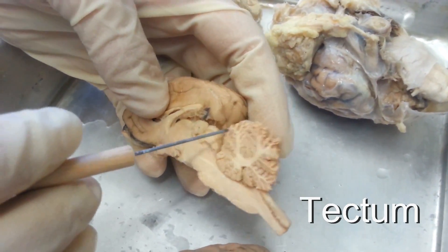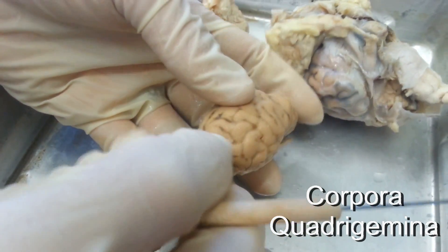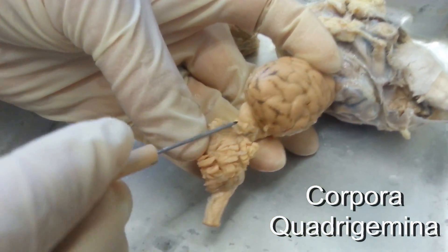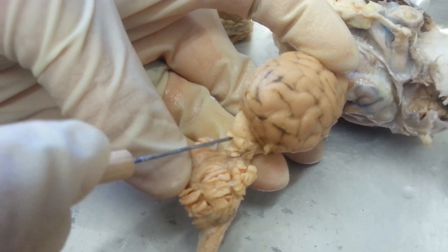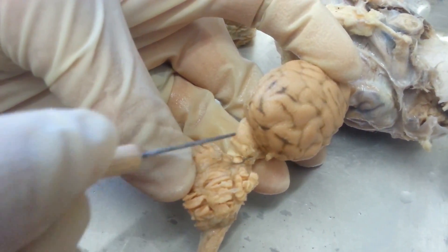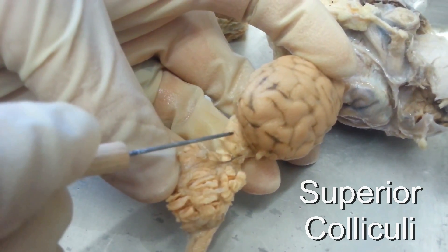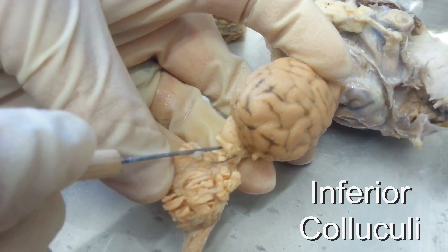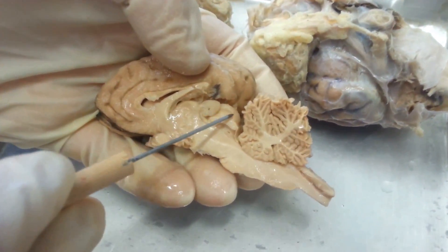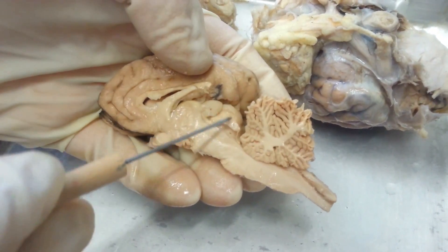You have the tectum, which is made up of your corpora quadrigemina. The easiest way to find it is to pull the cerebellum and the cerebrum apart — you can see those two raised portions that make up the corpora quadrigemina. The superior one is the superior colliculi and the inferior one is the inferior colliculi.